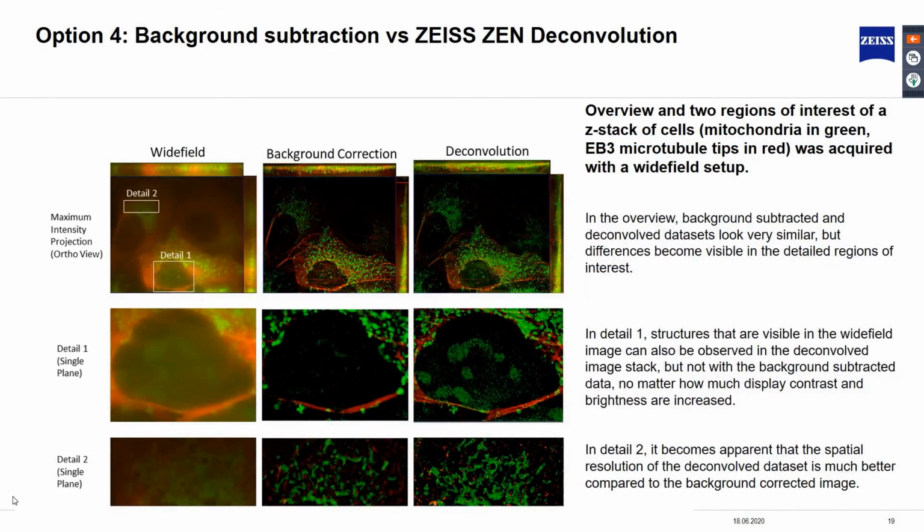Now, let's compare some datasets generated with background subtraction and deconvolution. This slide shows the widefield Z-stack image of cells labeled with MitoTracker in green fluorescence, while the end-binding protein EB3 on the microtubule tip was labeled in red fluorescence. The first row is the maximum intensity projection overview images. The datasets for the background subtraction and deconvolution look very similar here. Both show improved contrast compared to the widefield image on the left.